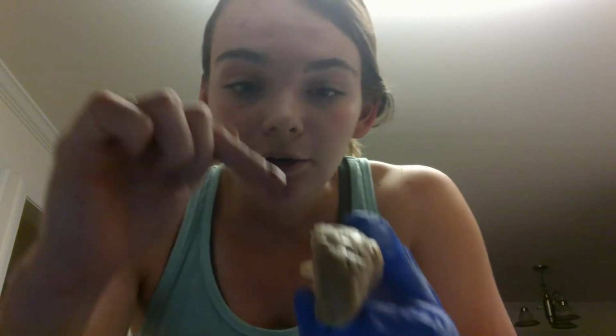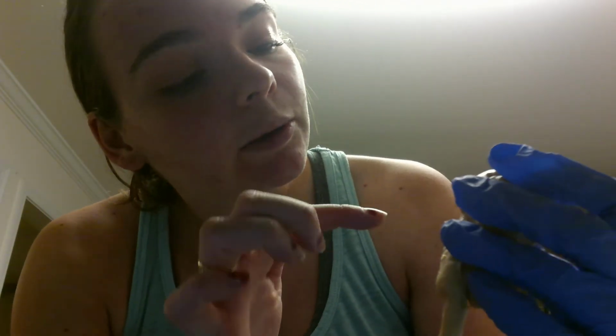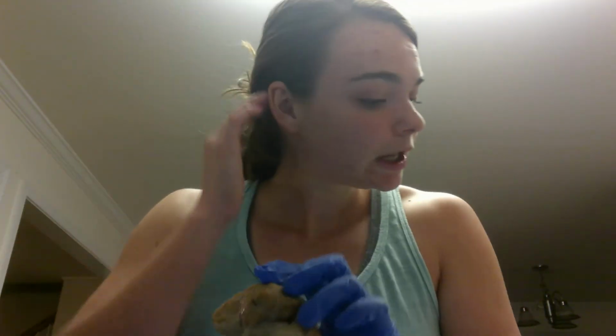And then here, right down the middle, this is the longitudinal fissure. It separates the two hemispheres, the right and left hemisphere of the brain. And then down here, it's a little more difficult to see, you have the lateral fissure, and that separates the temporal lobe from the parietal and frontal lobes. And then next, right in here, we have the corpus callosum. That is right there. Its primary job is to connect the right and left hemisphere of the brain and transfer information between the two of them.